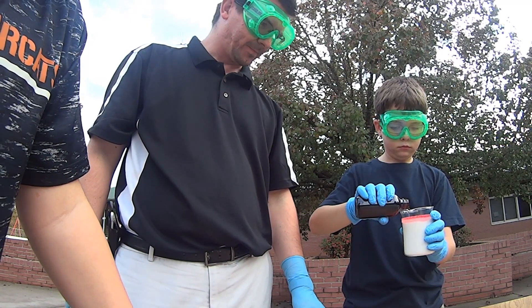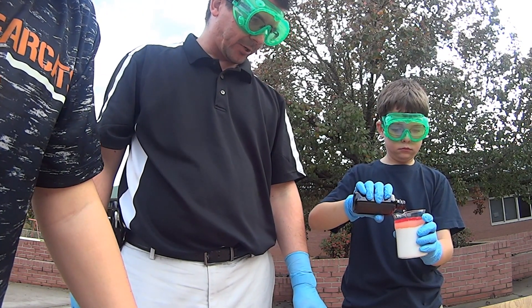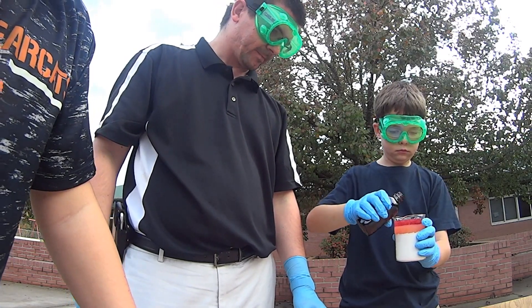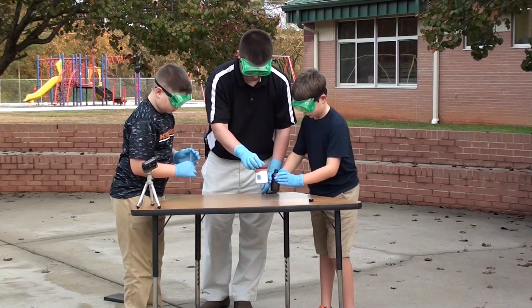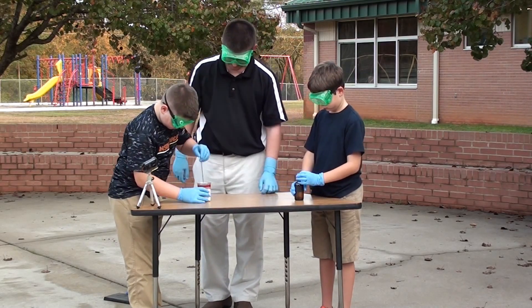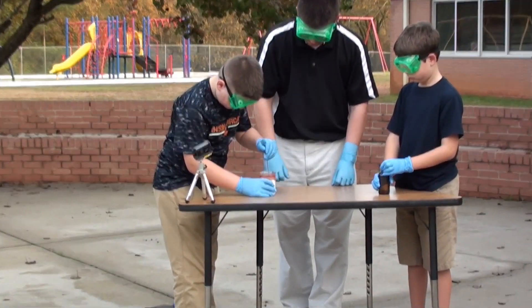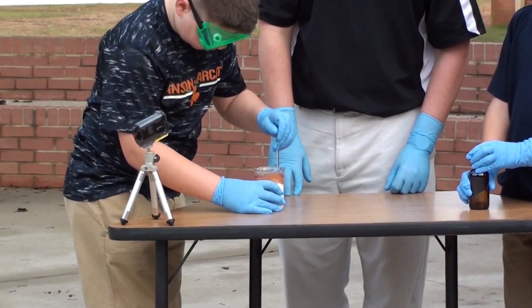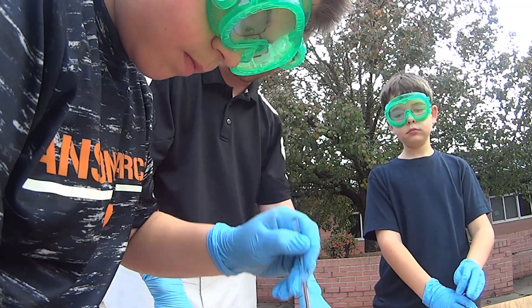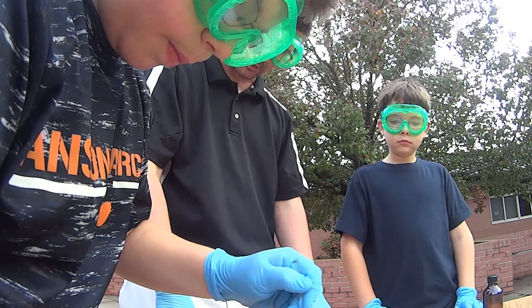It's going to kind of gel. Alright, it's kind of soaking in but Trent, I'm going to let you help it out a little bit — start kind of poking that down in there. You can see it mixing, you already see a chemical change taking place. What can we already notice happening to it?